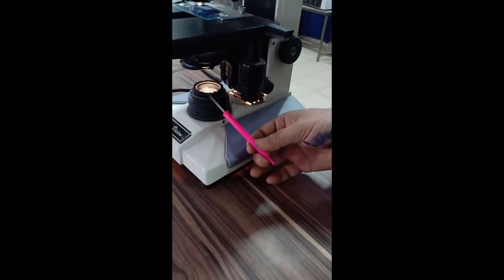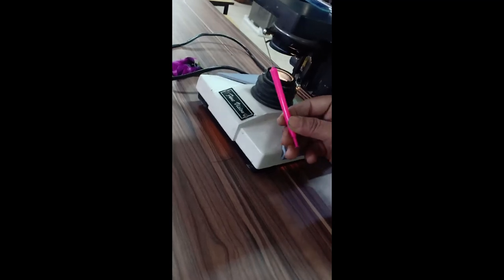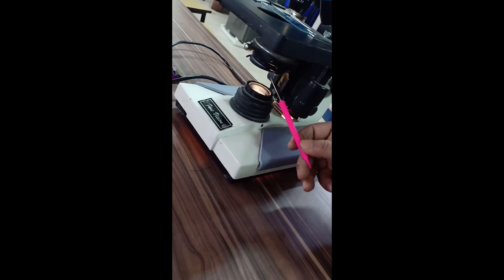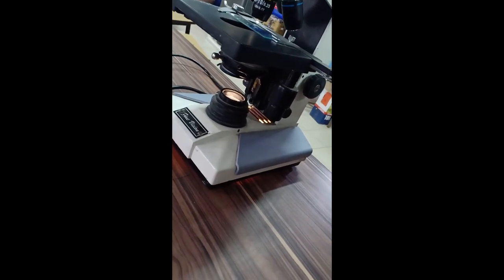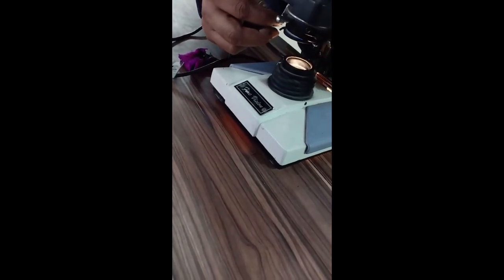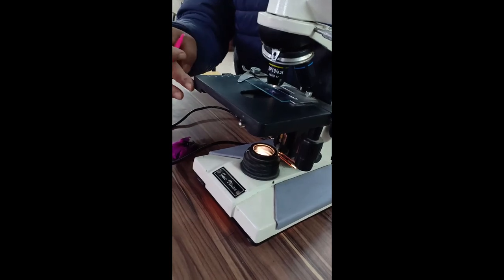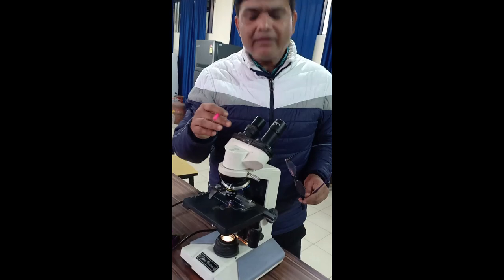There is a light source that passes through the diaphragm. Using the diaphragm adjuster, you can control the amount of light entering and hitting the glass slide. The stand and body part of the compound binocular microscope support the structure, and the electricity-powered light source provides illumination. This is an advanced form of compound microscope from which photographs can also be taken.